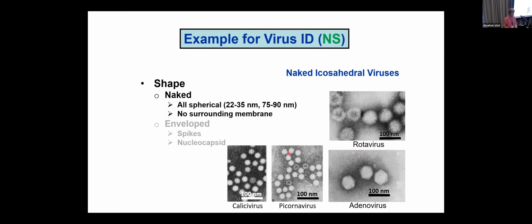On the other hand, some are called small round viruses because when you look at them, they're just fuzzy cotton balls so that you cannot really identify them. I know this is a picornavirus because I took the picture. By the way, two things. If I don't have a reference, they're my pictures, pardon me, and they don't need a reference. If I stole it from someone else, there is a reference that you can photograph.